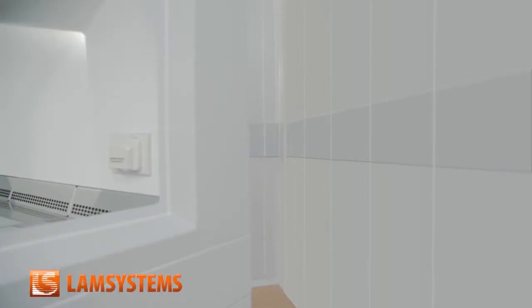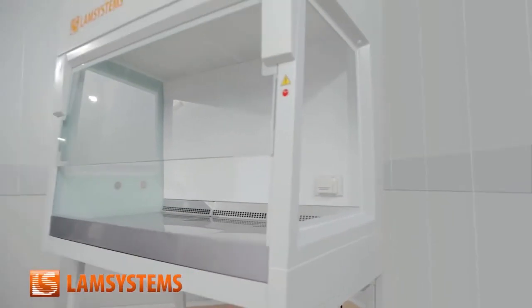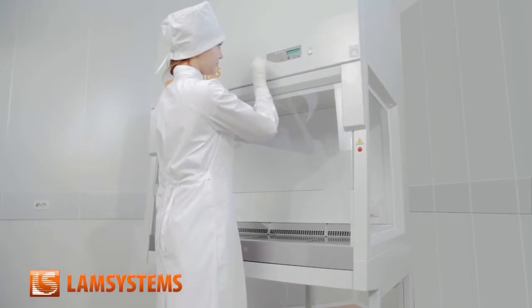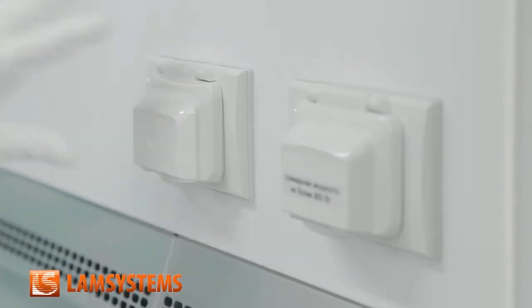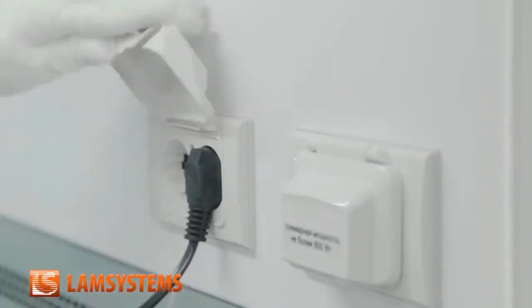When you connect the cabinet to the power source, it will come to a standby mode. The red light goes on, but the buttons don't function. Notice that in the standby mode the cabinet functions are off, but the outlets in the working chamber are alive and under voltage.